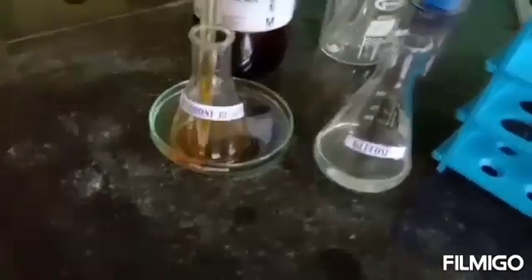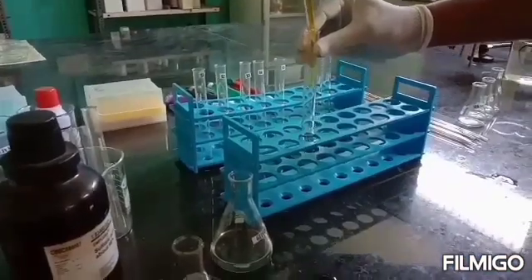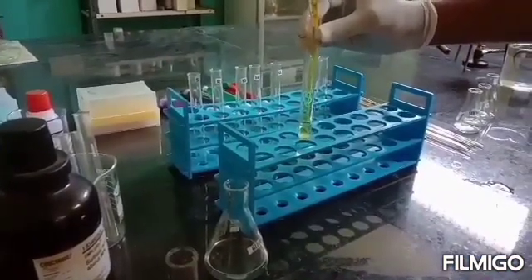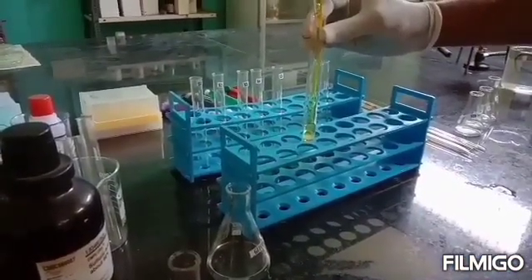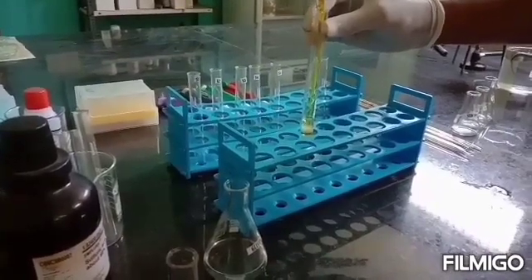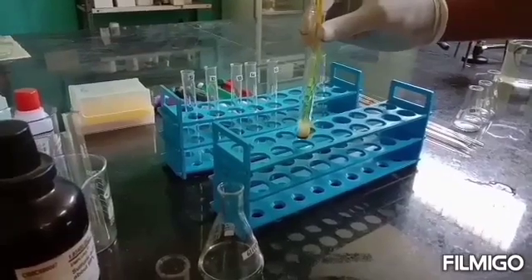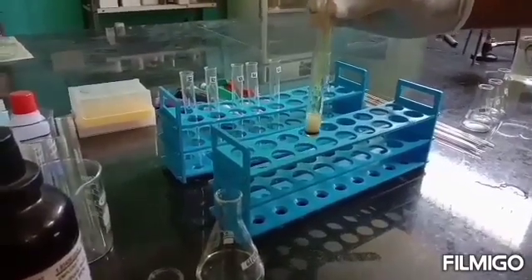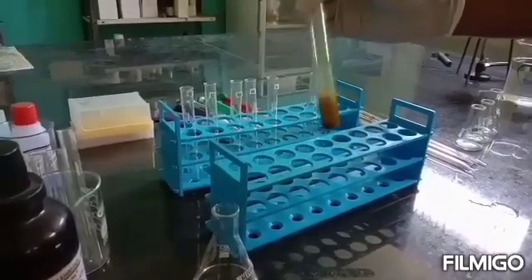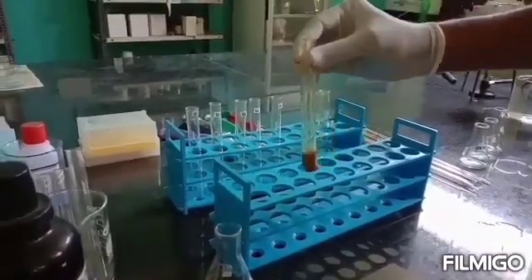Now we carefully add approximately 1 ml of anthrone reagent to the test tube slowly through the sides of the test tube, since it contains concentrated sulfuric acid. Immediately we can see a deep greenish blue precipitate appearing at the bottom of the test tube.